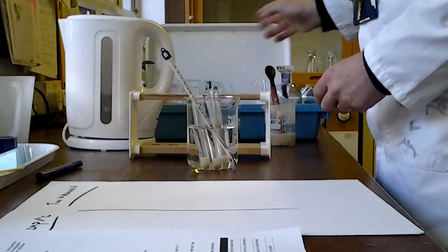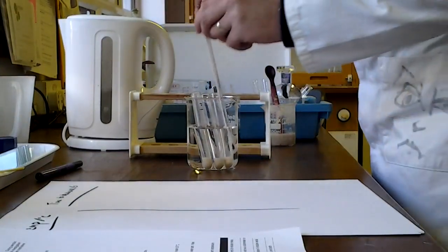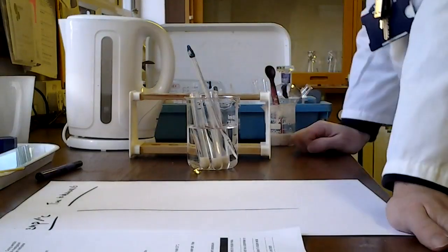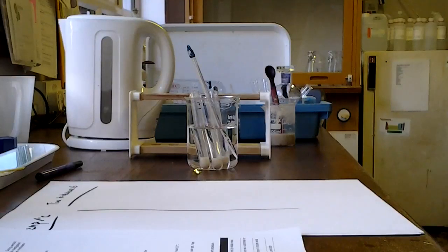stirring, and of course you shouldn't stir with a thermometer like I just did. You should use a glass rod, because it's less expensive if you break it. Well, that's going to take a few moments. I need to make sure that my yeast is at that temperature, my starting temperature, because that's really important. That's the variable we're changing. So I'm just going to leave that for a second.